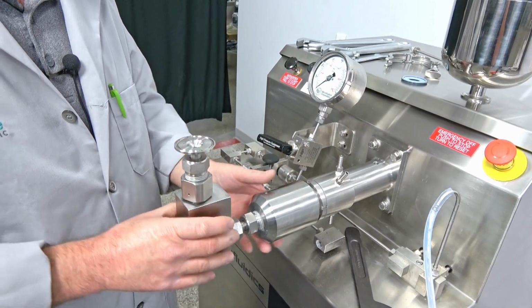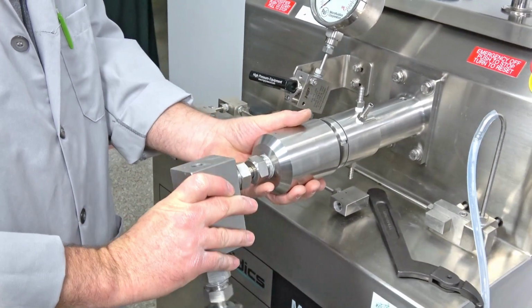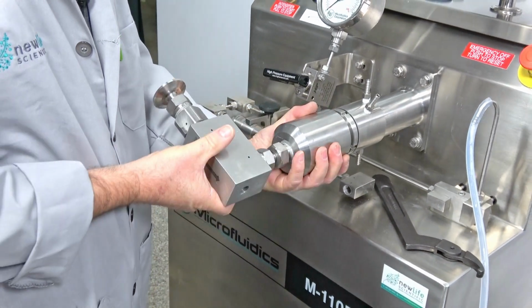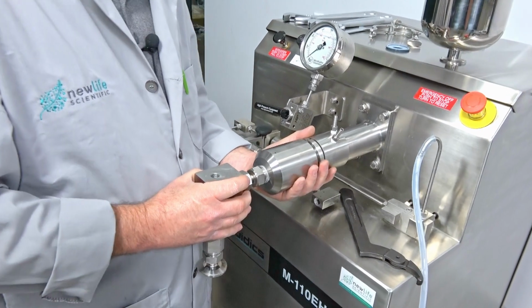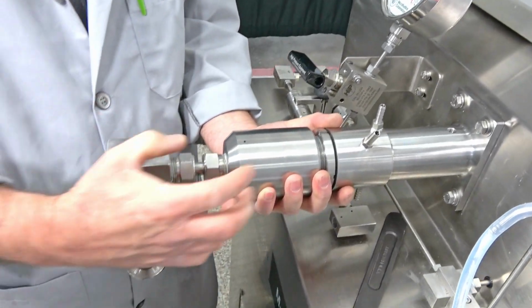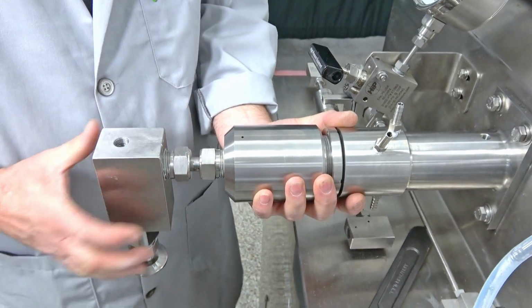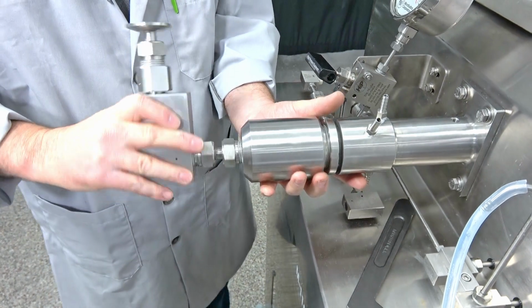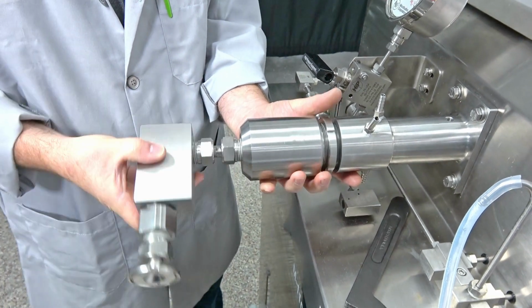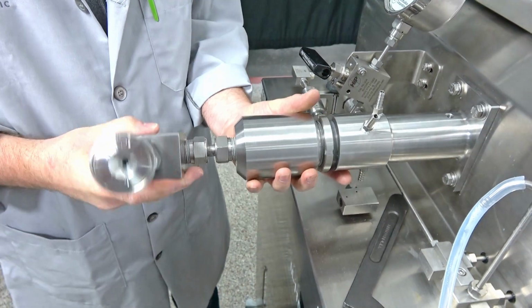So with that loose, this whole thing is loose now. And we're probably going to get a little bit of fluid dripping out of it. And this is where it's really important to have a good hold on this, because there's a ceramic plunger in here when we get the threads out far enough, and we don't want to damage that plunger because we'd have to replace that if we damage it. So we're just holding this whole assembly and turning it off.